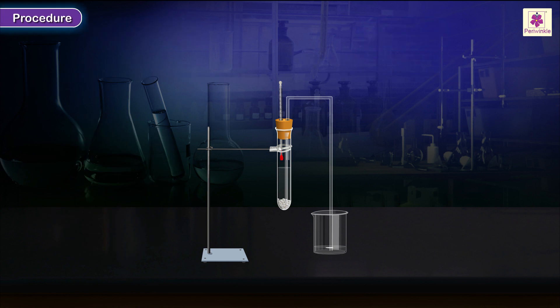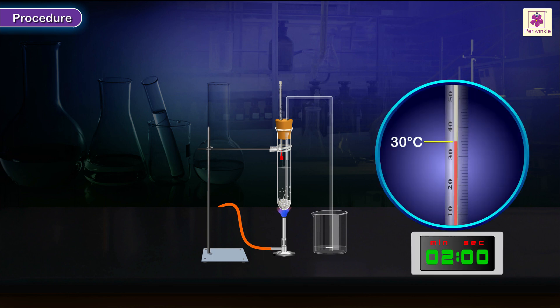Procedure. Gently heat the test tube at its base and observe. Note the temperature shown by the thermometer after fixed intervals of time.